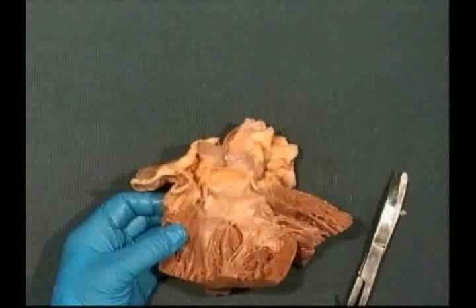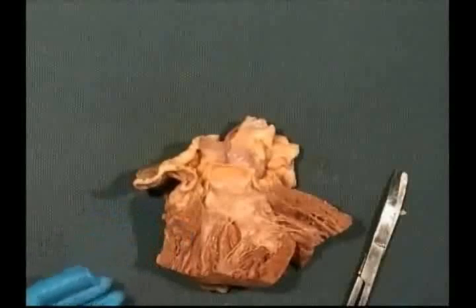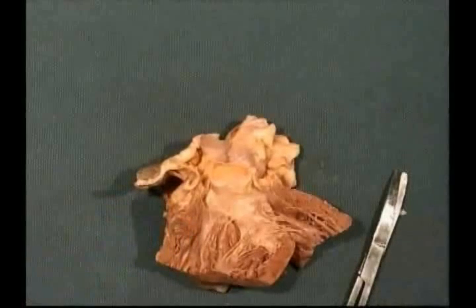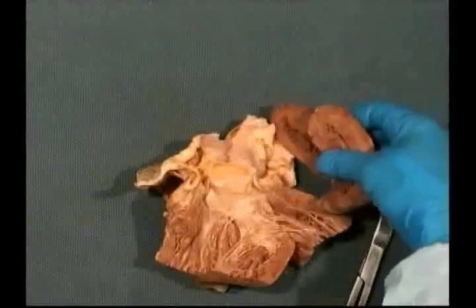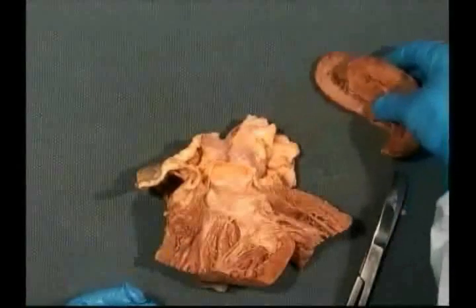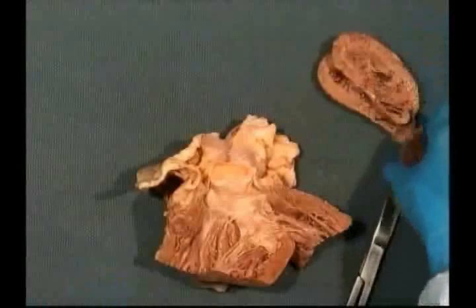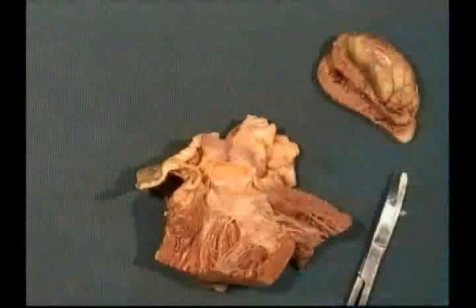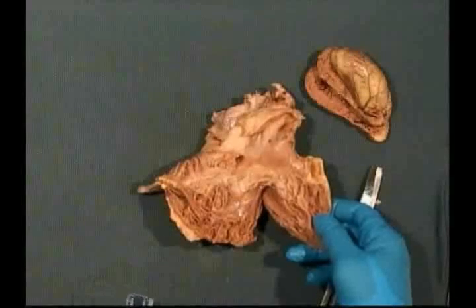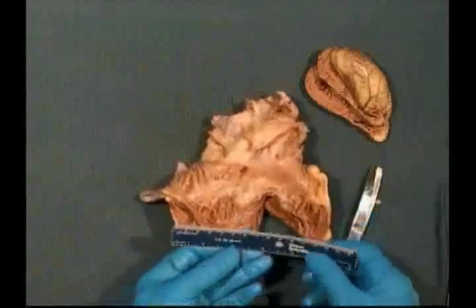At this point you can take all your pieces of heart and put them back together and weigh the heart. We have removed all postmortem clot and most of the great vessels, so we can get an accurate heart weight. The measurements we do want to make on the heart that are important and should be done on every heart are the valvular dimensions and wall thicknesses. Again, these may not reflect what's going on in life, but it's the best we can do.